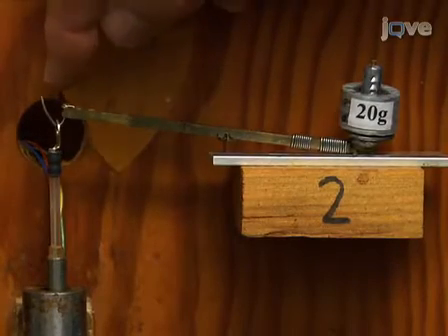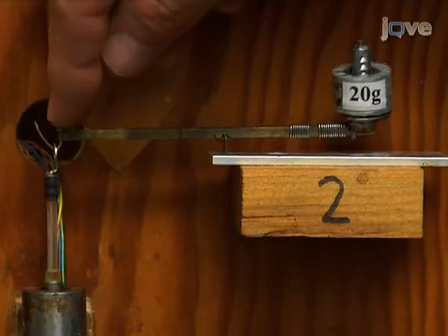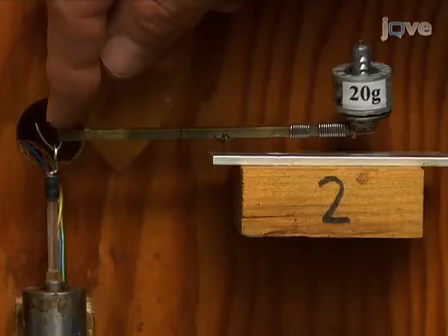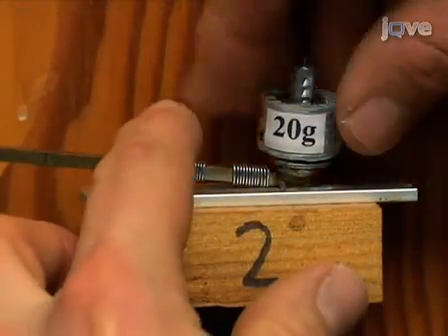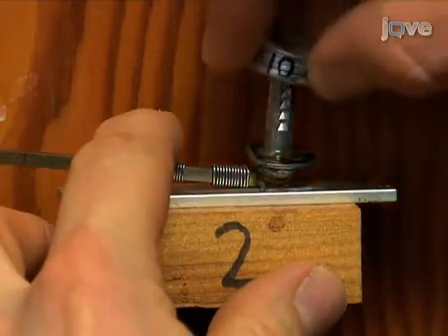The upper end of the rod is linked to a lever with an adjustable counterweight. This lever exerts an adjustable amount of upward force on the wall sample. The force is adjusted by adding or removing calibrated metal weights to the far end of the lever.